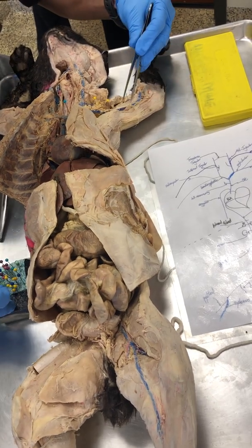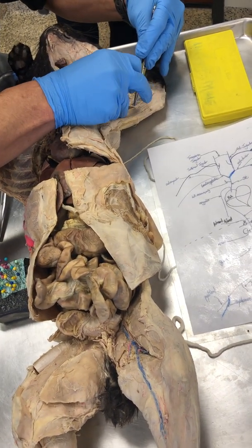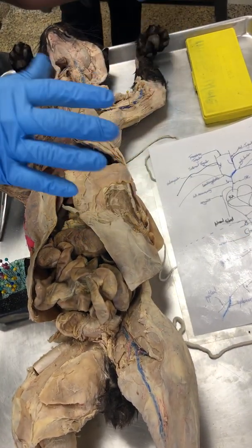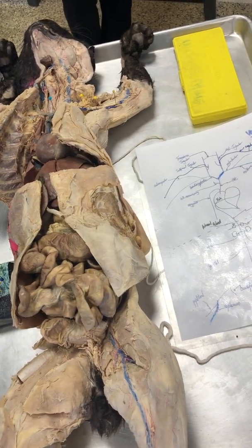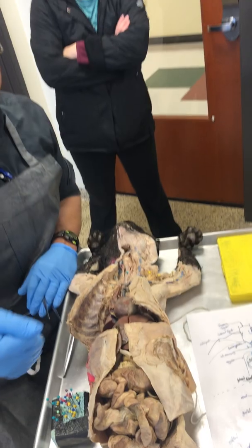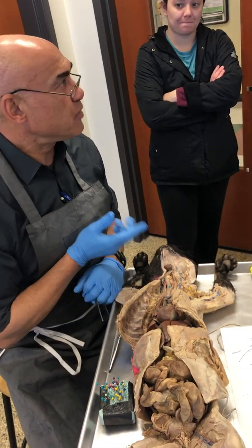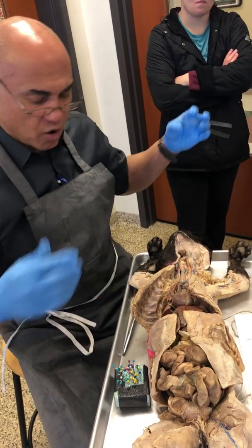Now we are in the upper arm area. And what is the upper arm area called? Brachial vein. You see, now we're jumping way back to lab number 1 or lecture number 1 of BIO 141, those roots of words, directional terms, body. Because if I remember that, now I remember all of this, right? Axillary armpit, brachial upper arm.